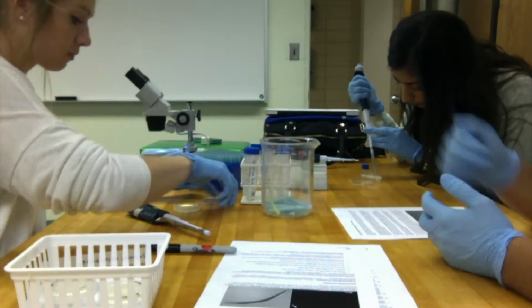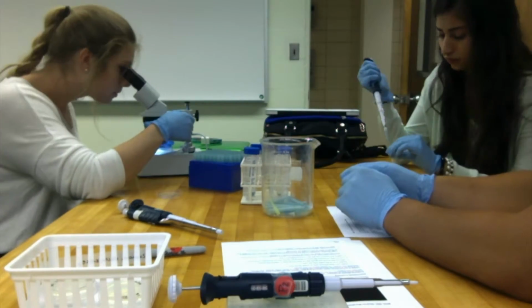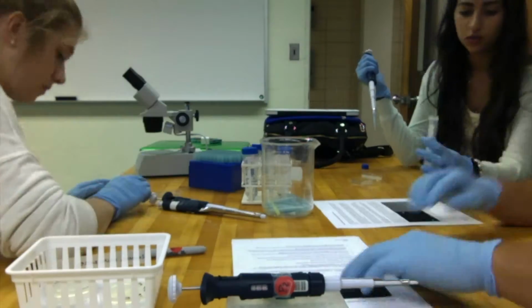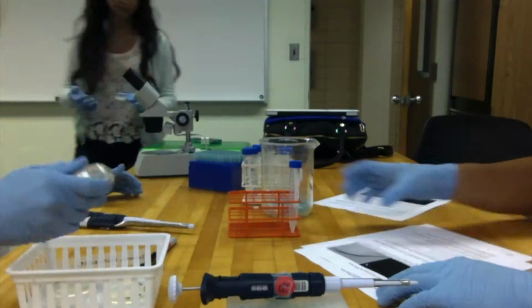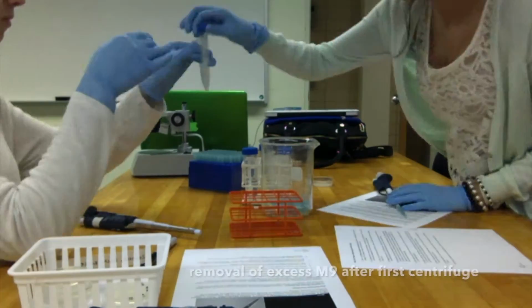Two plates containing wild-type and mutant worms were obtained. 2 milliliters of M9 buffer was pipetted onto each plate, swirled and tilted to remove the worms from the agar. The worms were gathered into a 15 milliliter conical vessel. The tubes were then centrifuged at 2,000 revolutions per minute for 2 minutes in order to obtain a pellet of worms at the bottom of the tubes.